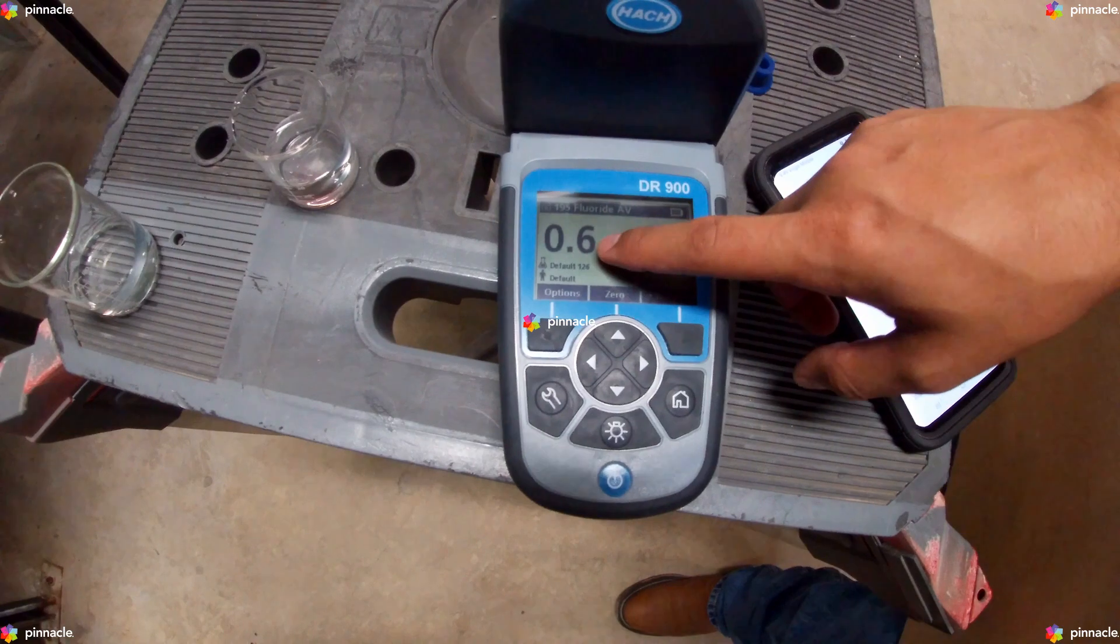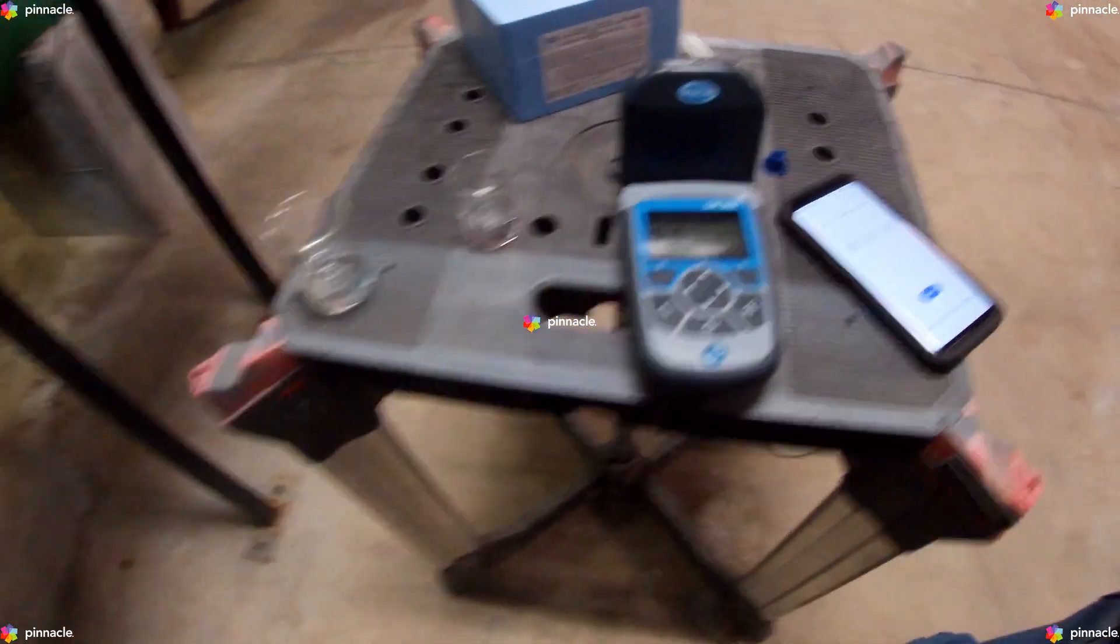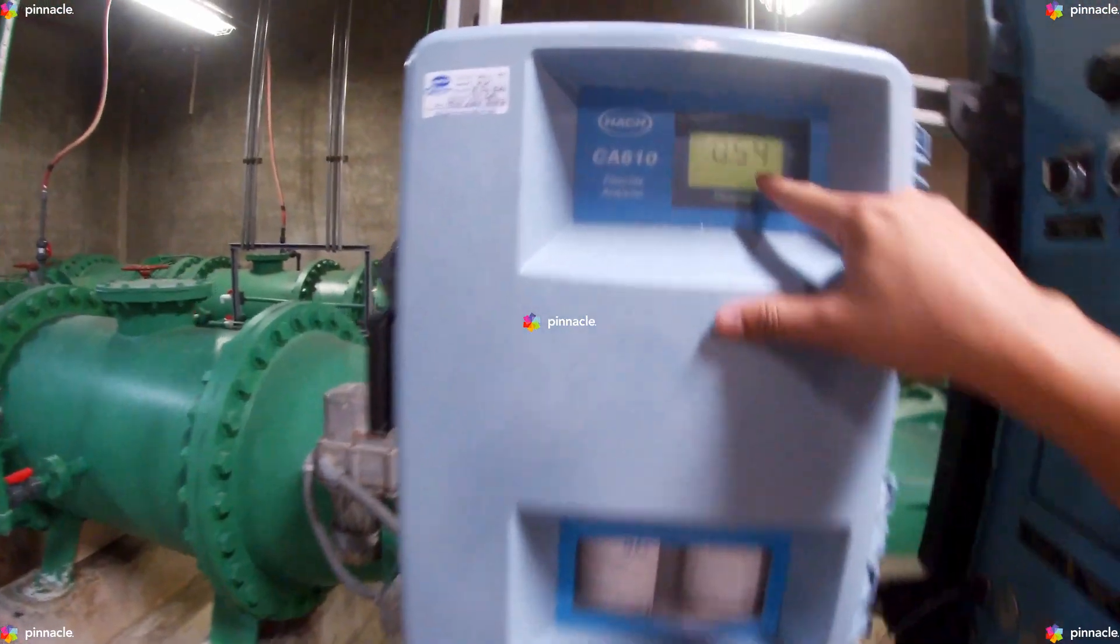We will then compare our readings to that of the CA610.